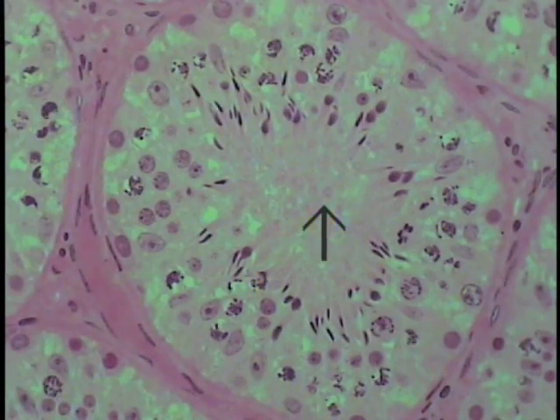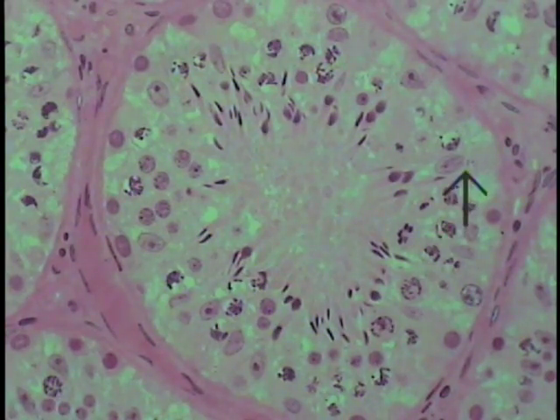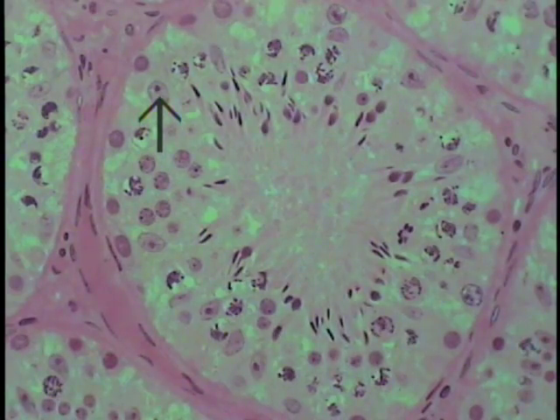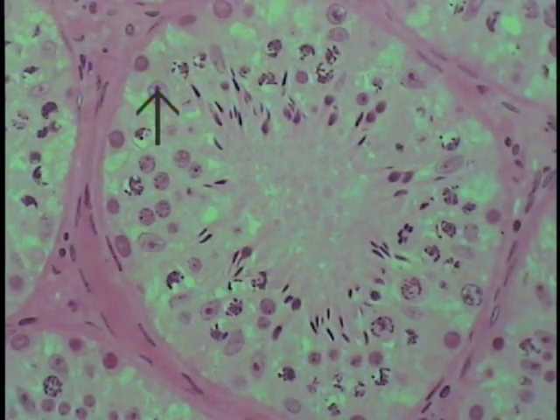This field is a cross-section of a seminiferous tubule seen at increased magnification. One of the first things to do is identify the position of the Sertoli cells. Several Sertoli cell nuclei are shown at various locations, each having a well-defined nucleus with a characteristic nucleolar profile. These Sertoli cells can be identified throughout the tubule wall.